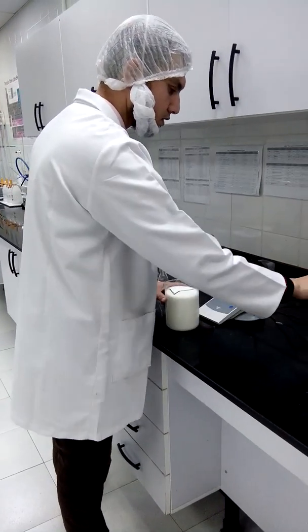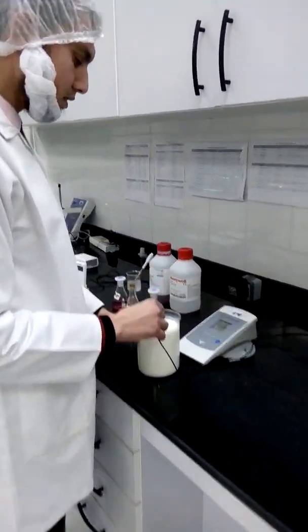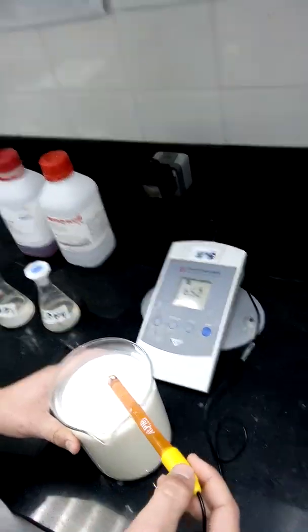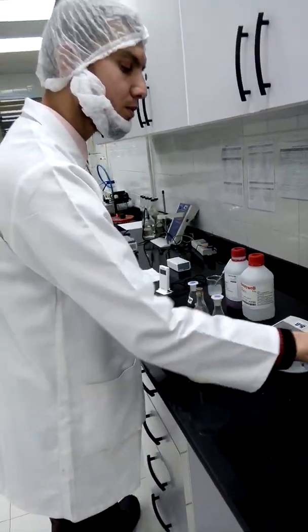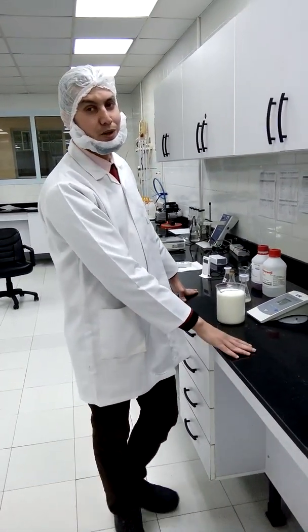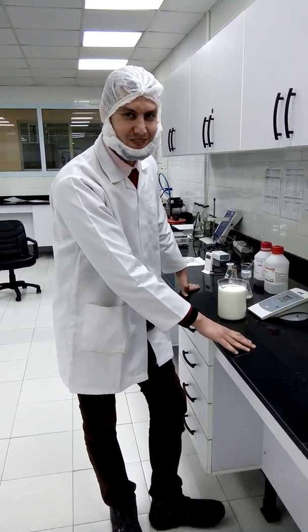Our pH reading will be 6.52. Today we have learned how we can measure pH for milk samples. Thank you!